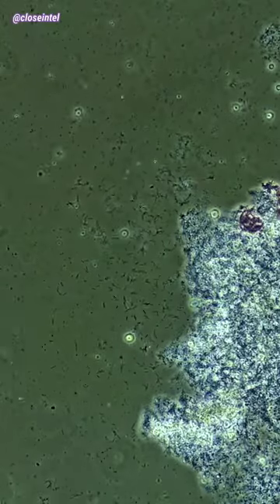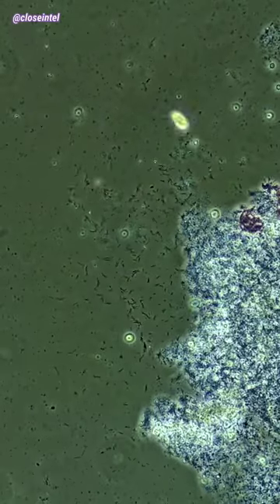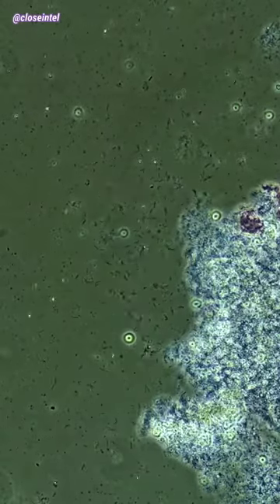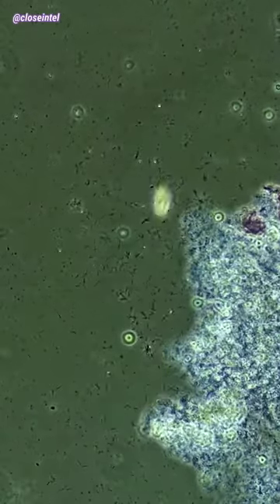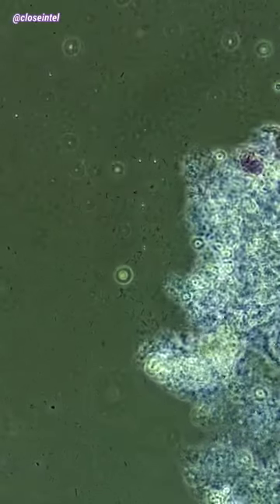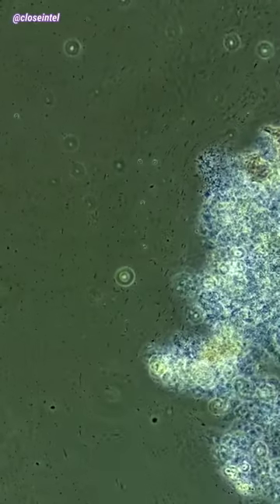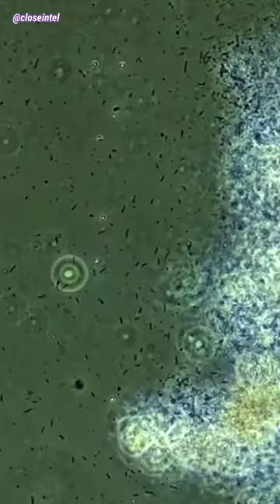All those moving rods you see are bacteria called bacillus, and you can tell when I add the bleach since the water starts moving around them. Once it comes in contact, you can see that they all slowly stop moving.